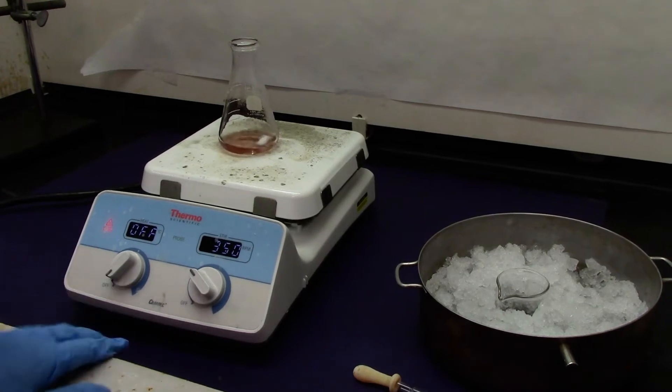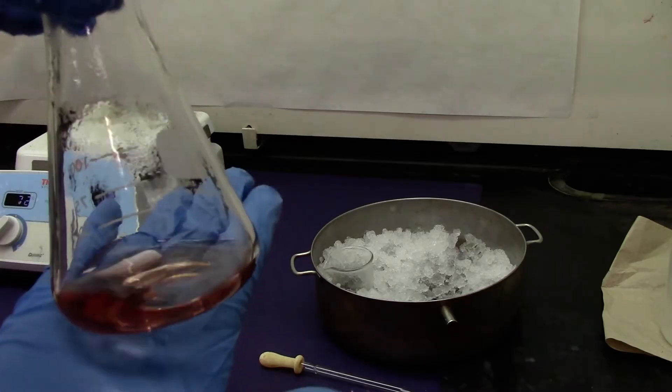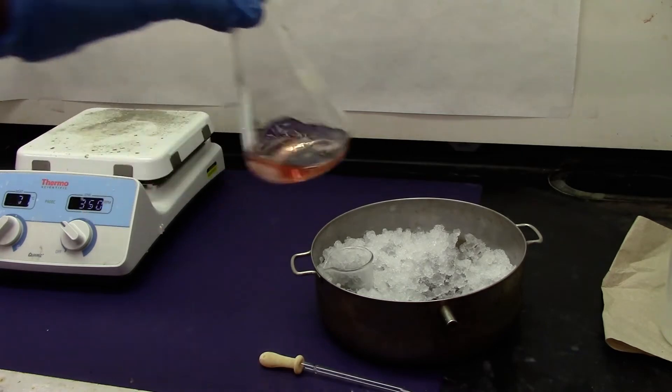Turn off the heating when the solution is homogeneous. Once the homogeneous solution is formed we'll place it in the ice bath.